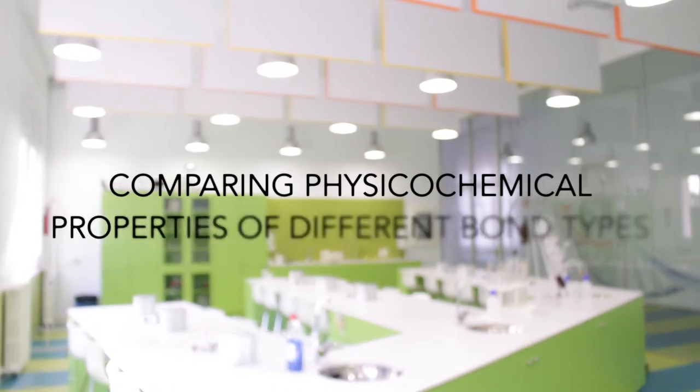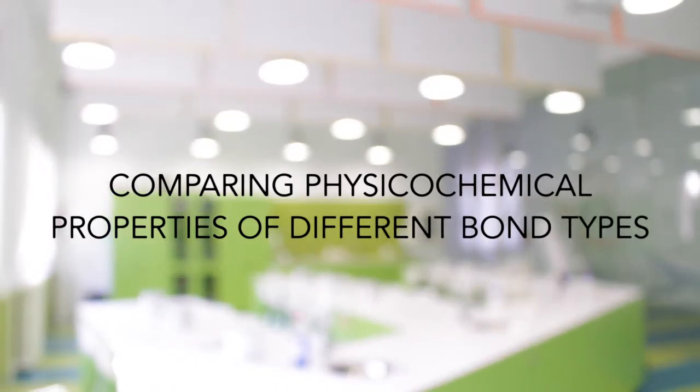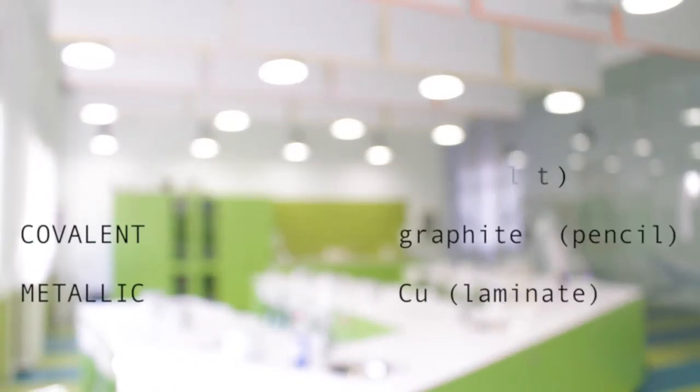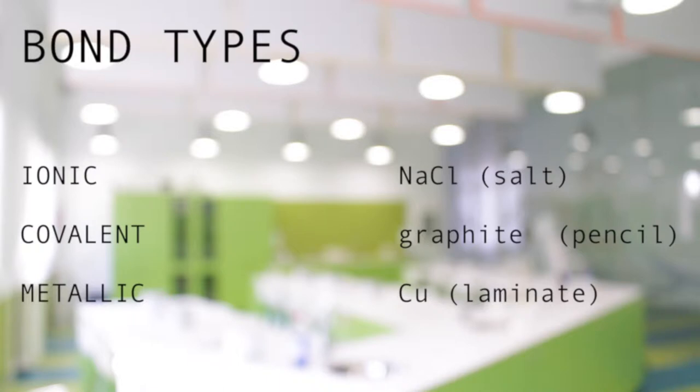Welcome to our experiment. In order to answer research questions, we are going to take a representative of each bond type in chemistry: salt, graphite, and copper.